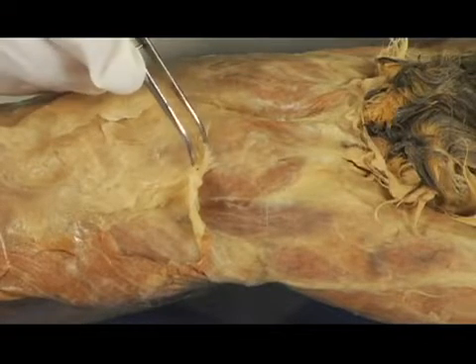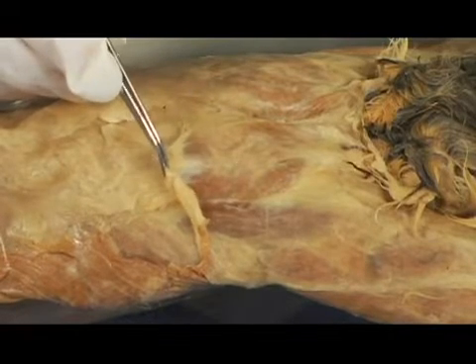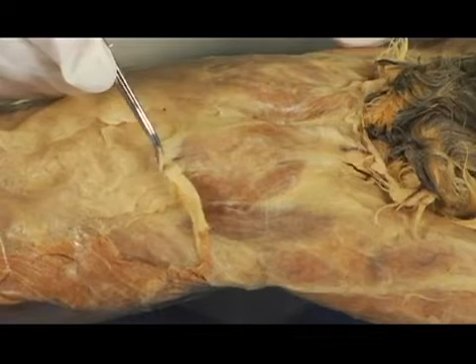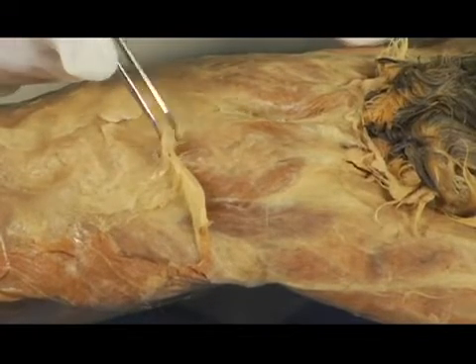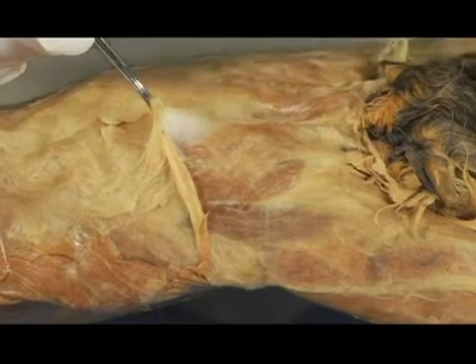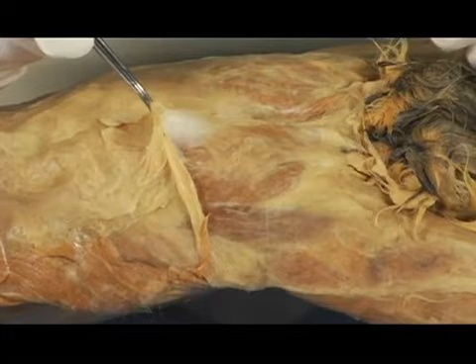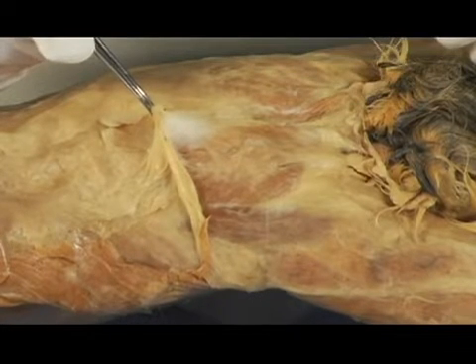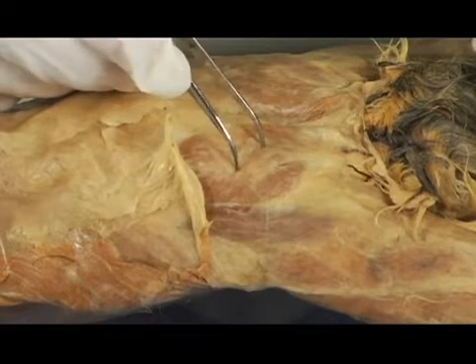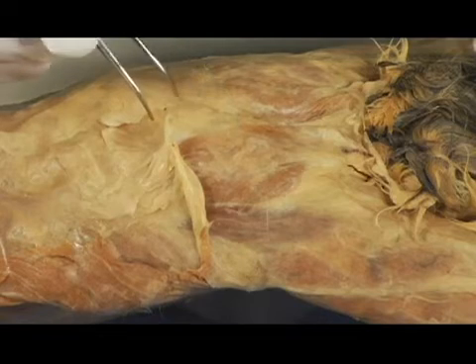So I'm just going to go ahead and take the tweezers and tug a little bit on this tissue. Now, really the trick is to go slow, okay? Don't feel like you have to rush. You can see what I'm doing here as I pull up. And if you notice this, it's kind of whitish, kind of cottony material. That's the material that needs to be removed, okay? That's not muscle. It won't harm the cat to remove that. But if you get any further down into this darker tissue, and if that starts to tear, then you'll have a problem because, in fact, that's the muscle.